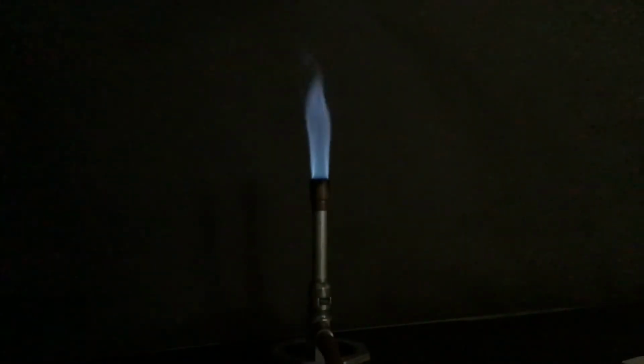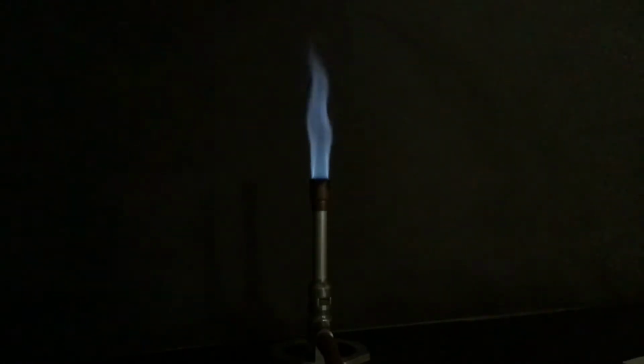Okay, so I have this Bunsen burner up against a black background so that hopefully we're able to pretty easily pick out the color of the flame, of the substance that we're testing. So we're going to go in the same order that I have written on your lab handout sheet. I'm going to go through these pretty quickly, but if you need to slow down so you can write down observations, you'll notice that some of them have colors that are very similar to one another. So you want to be really descriptive in the colors and the descriptions that you are writing down.